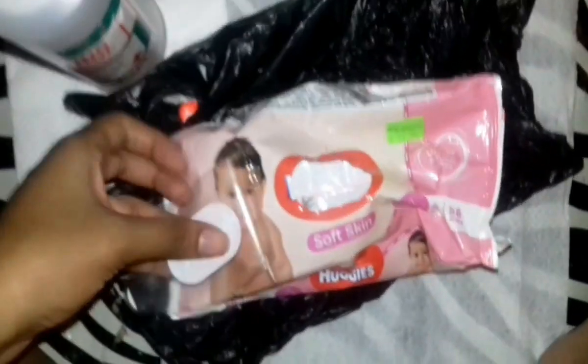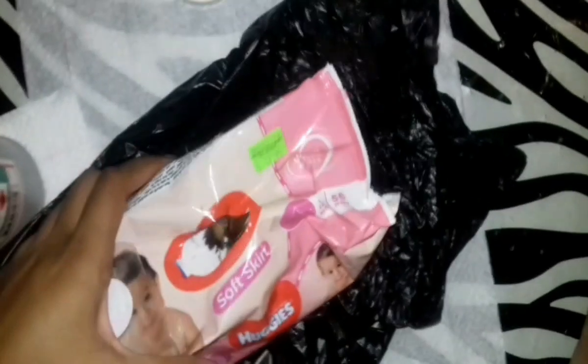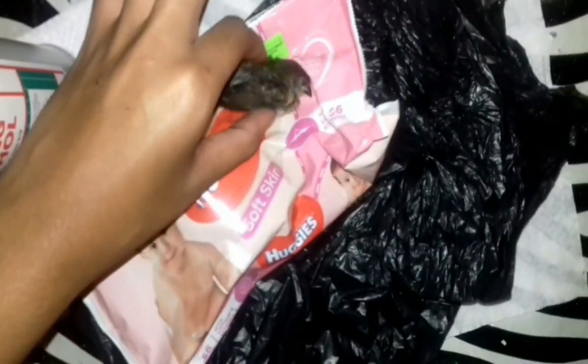It's in this container because I froze it. I got it this morning but I had to go to school, so I had to freeze it. You can see the little birdie — the feathers look quite normal. I'm just gonna take him out by his feet. He's frozen.